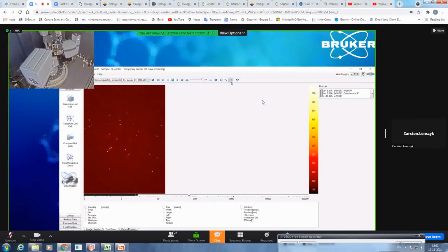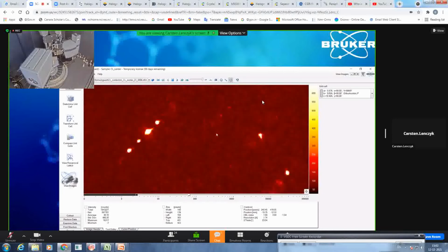Second, you have this region of interest tool where you can draw a rectangle. So here you can also use the zoom function if you want to check more closely about the shapes. So you see here you have mostly, like, 3 or 4 are nicely shaped. This one is more intense.